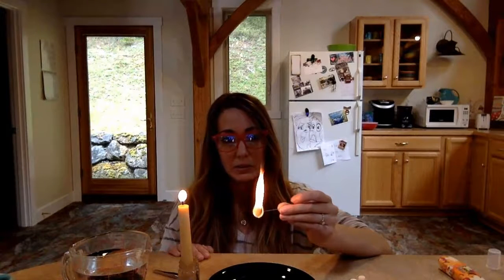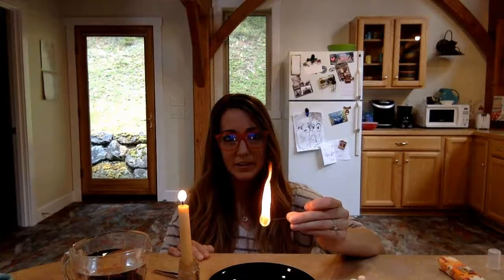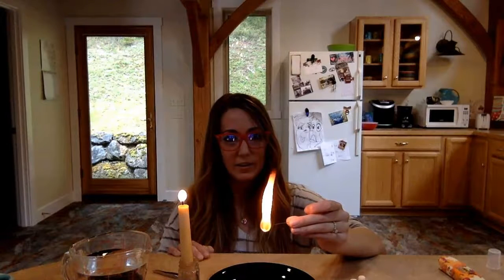Oh, it's just getting started. It's letting off blue sparks. Ooh! Oh, cool. Oh, sparks are flying. Maybe I should have worn mittens. Oh, it's like a comet. Just keeps going. Wow.